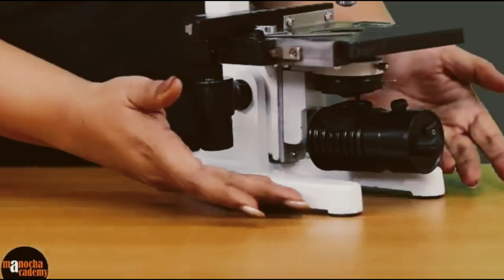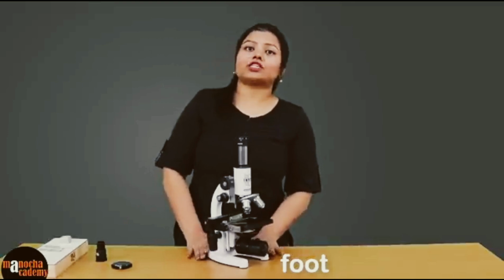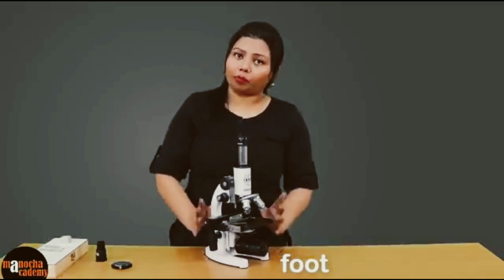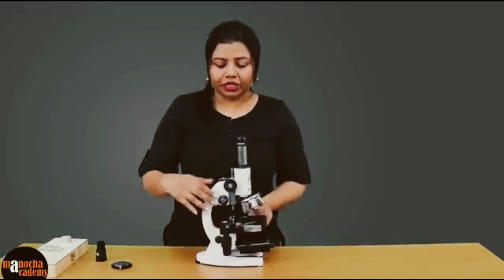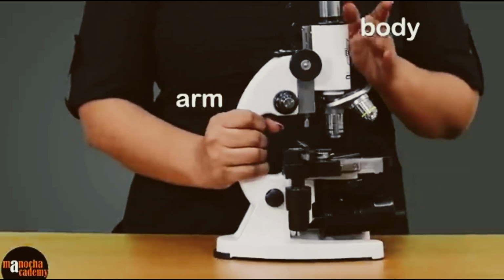So the first part of the microscope that you see here is this region, which is known as the foot. The foot is the base on which this entire microscope is standing. Here, this arched part is known as the arm, and the arm is holding this body to which two types of lenses are attached.